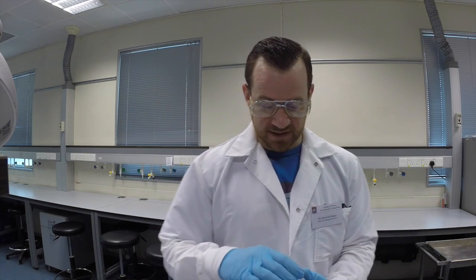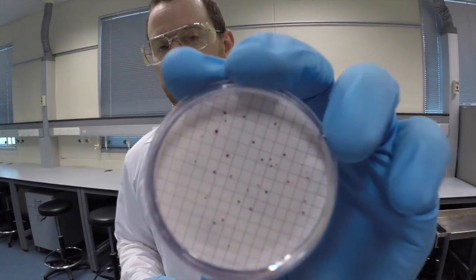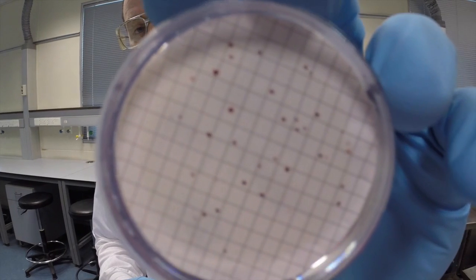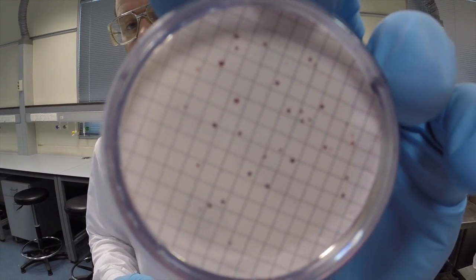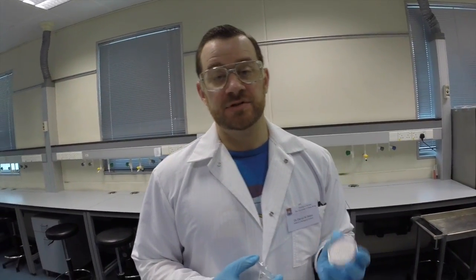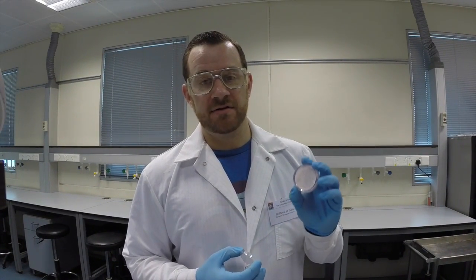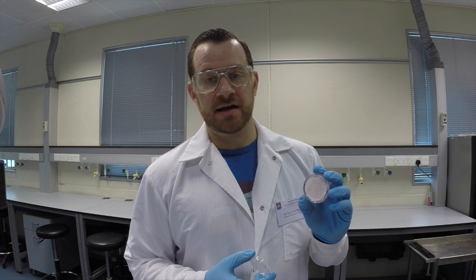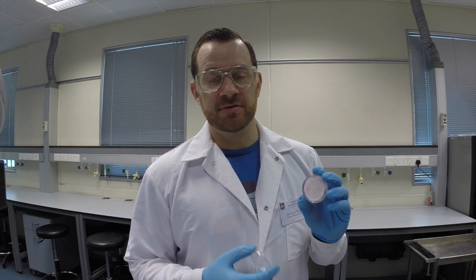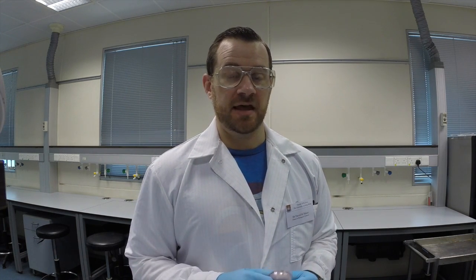And to show you an example, here is a plate that is growing some Enterococcus. And you can see the reddish colonies that have grown up over a 24 to 48 hour period. And those are easily countable on the gridded membrane, and we can normalize them to 100 milliliters. So if this was the result of a 1 milliliter filtration, then we would multiply by 100 to get the number of colony forming units per 100 milliliters of that solution. And that's how you measure Enterococcus in seawater.